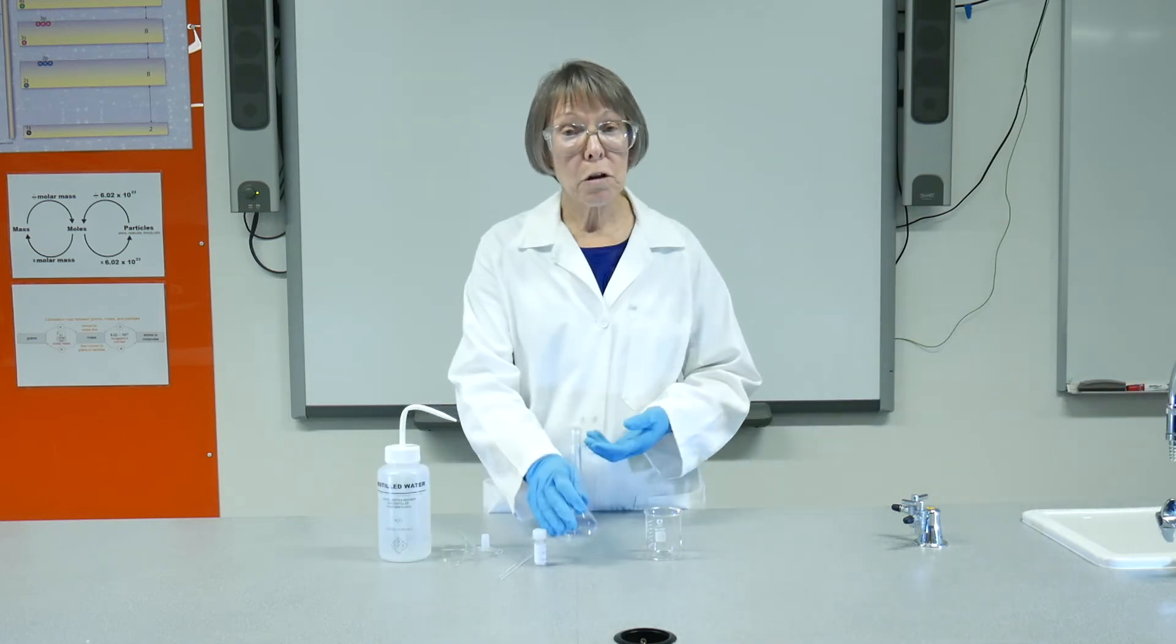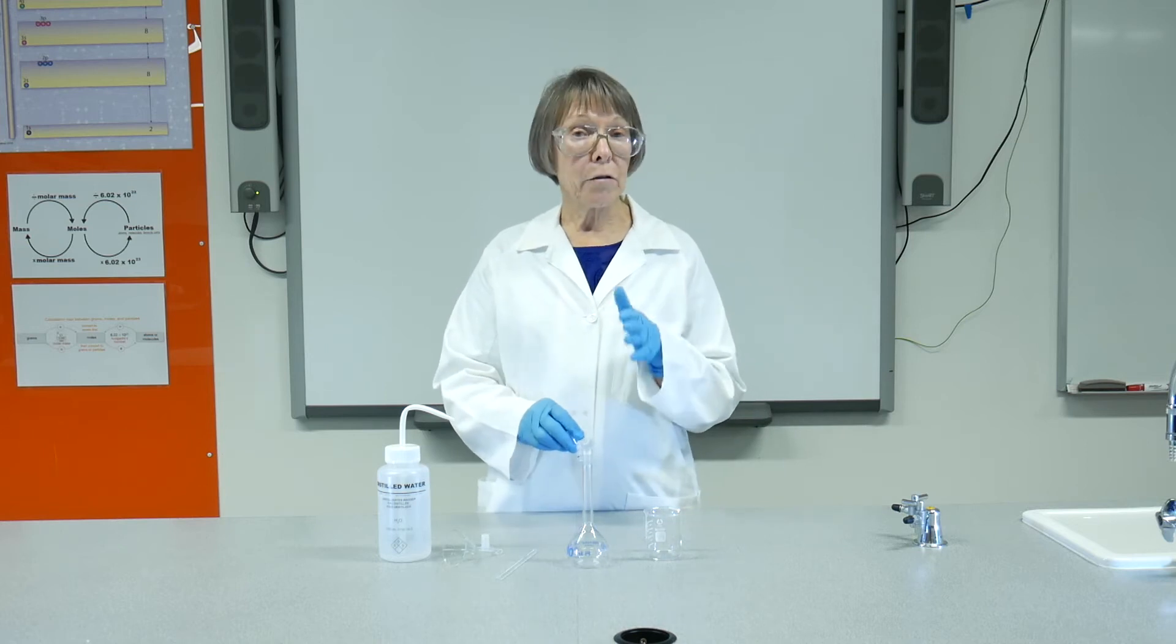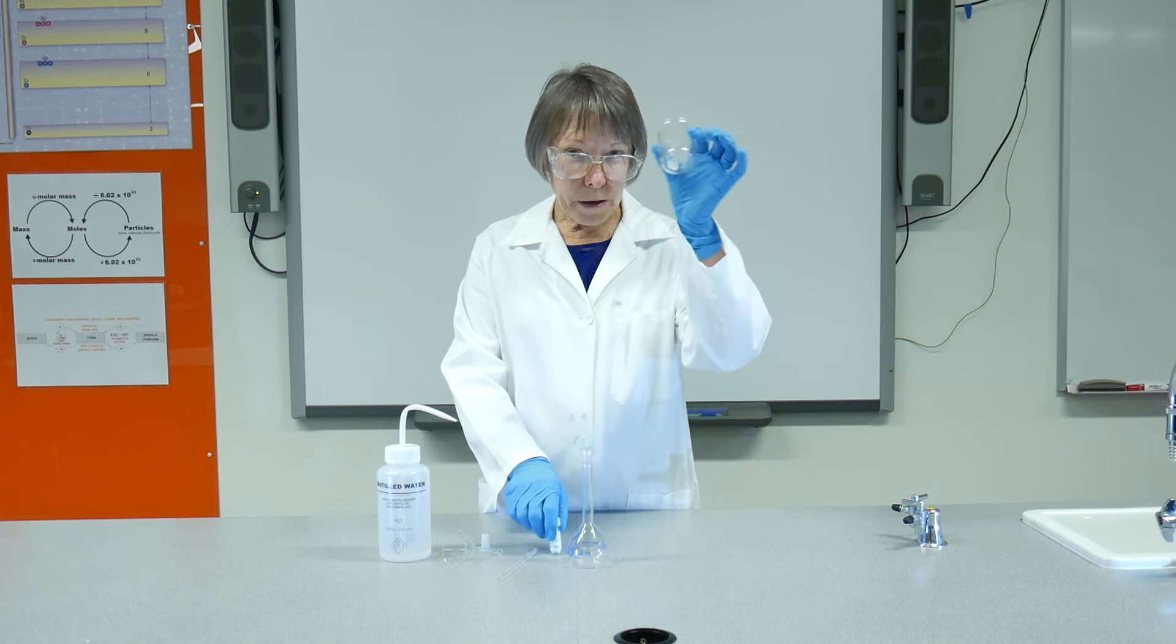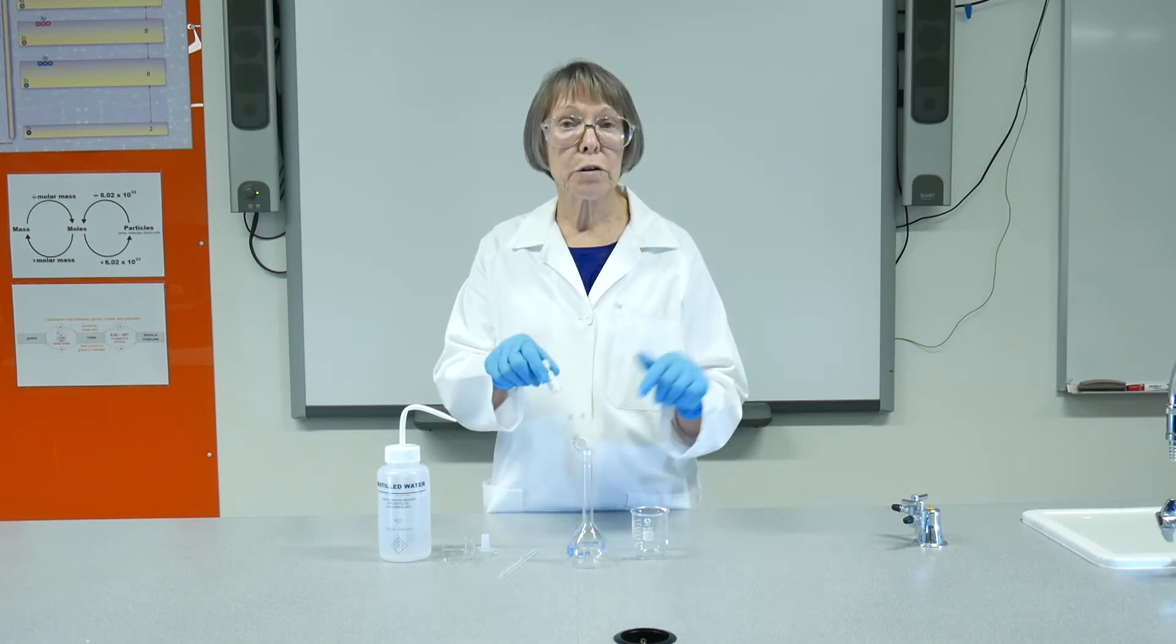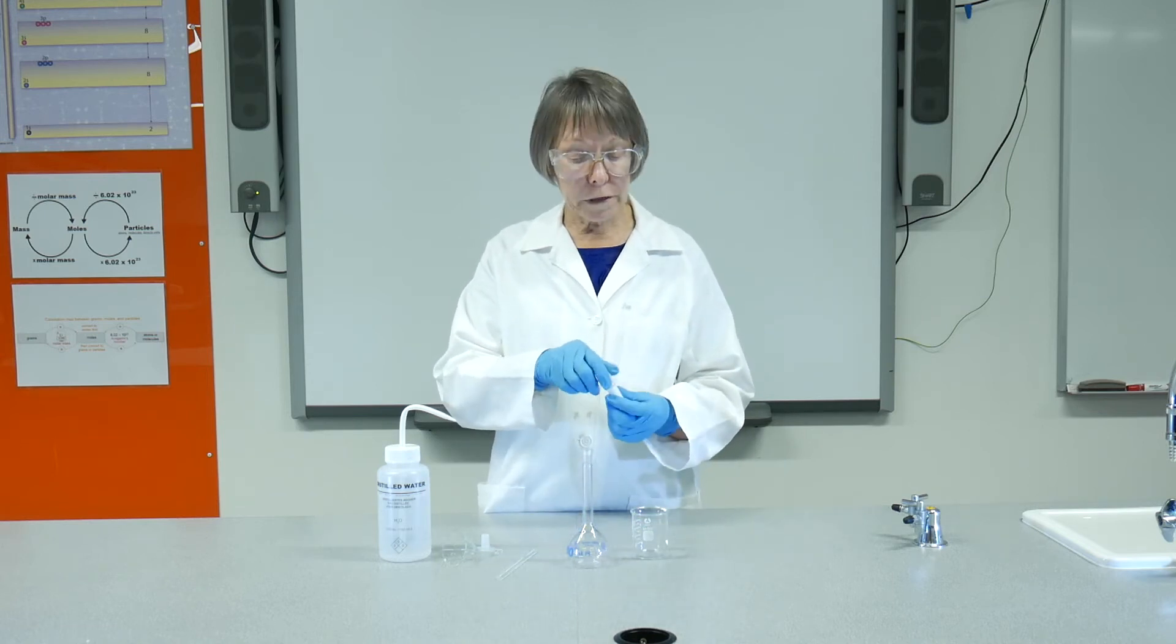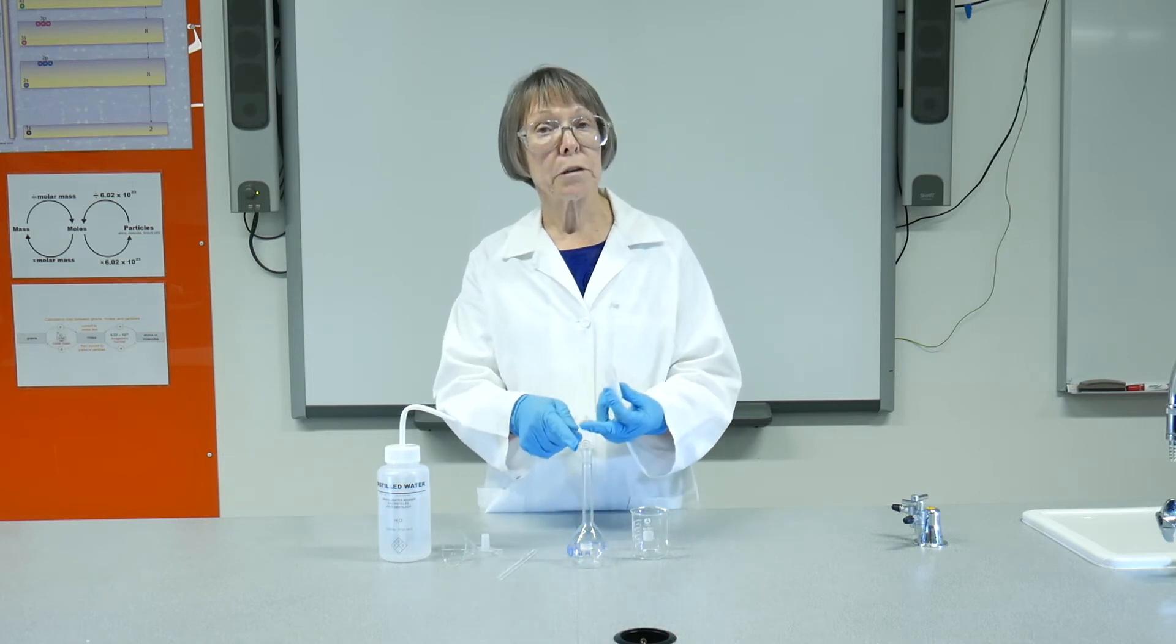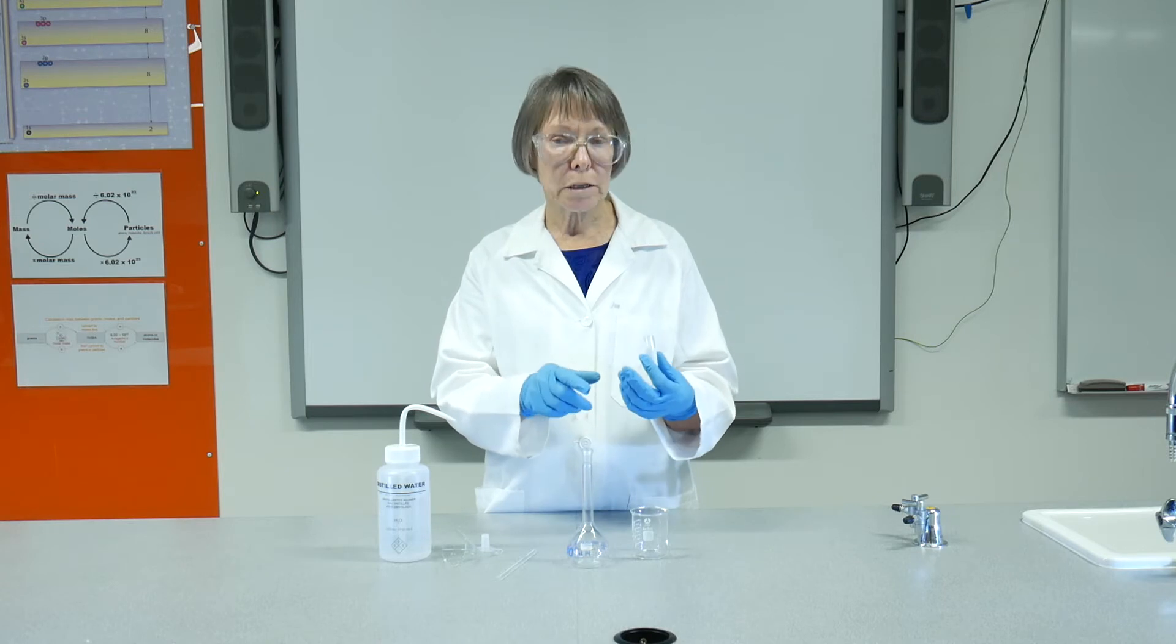I'm going to use a solid to make up a solution of accurately known concentration. So I have a beaker. I'm going to transfer the solid into the beaker, dissolve it in the beaker, and then once it is dissolved, transfer it to the flask. Every operation here has to be quantitative.